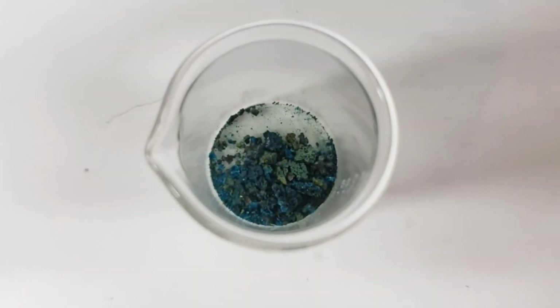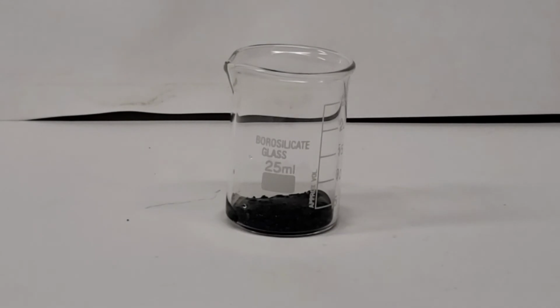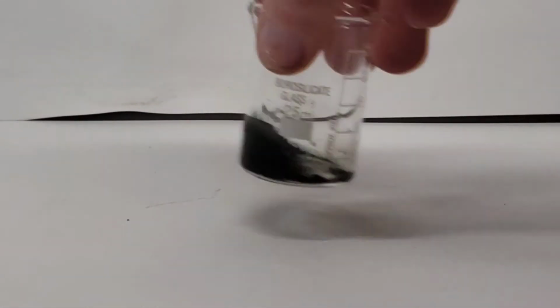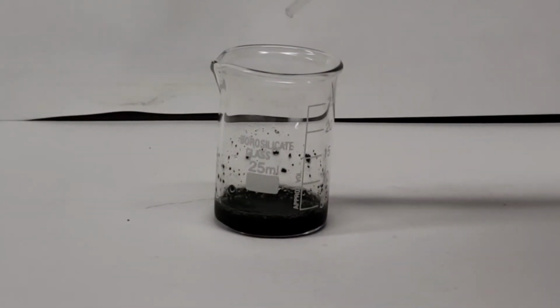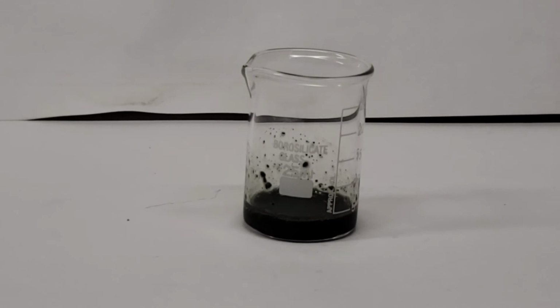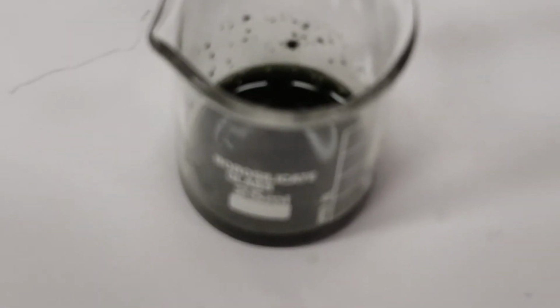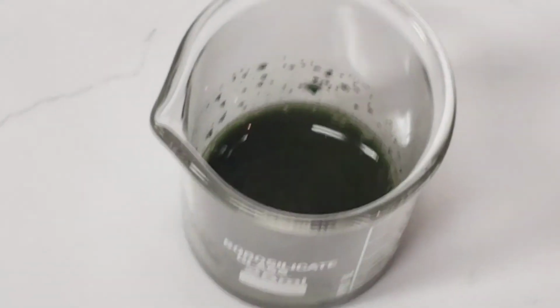So I took a small amount and put it in a little beaker, and then added some water to the point where it was just able to dissolve all of it. Which did seem to work, but now that it had the carbon in it, it seemed to form a super opaque solution, which was obviously really dark and really different from just the copper acetate solution that there was before. And interestingly enough, it seemed for some reason to form a little bit of a greenish hue to it. I really don't know why, but as you can tell, I got interested and put the camera up close to it. It just got a little greenish.